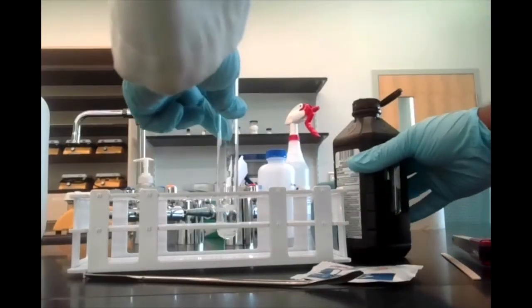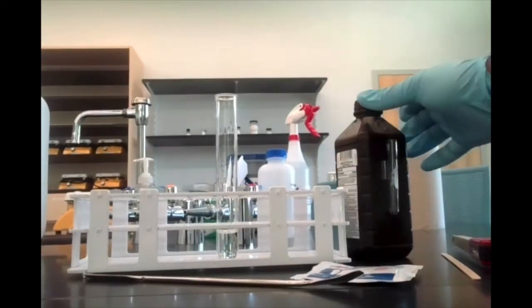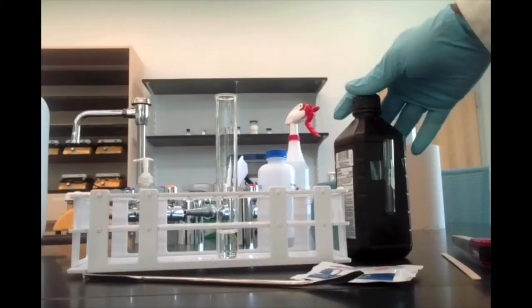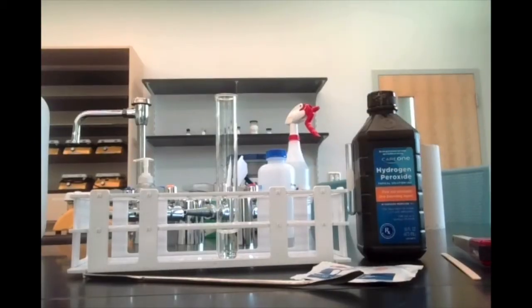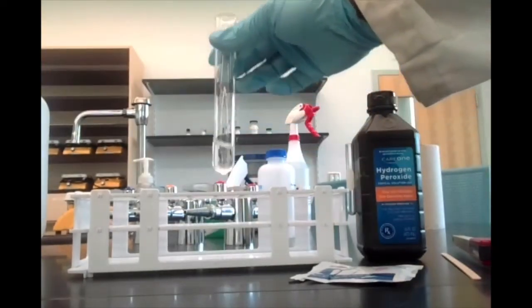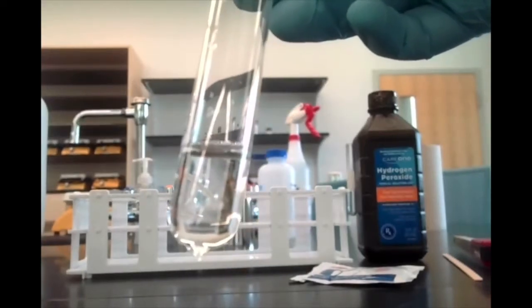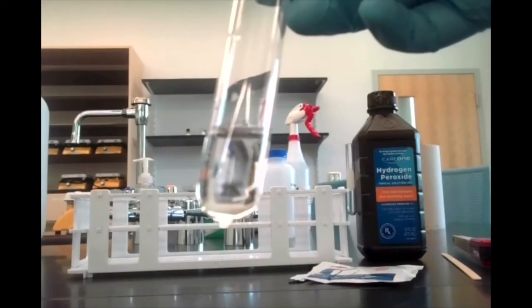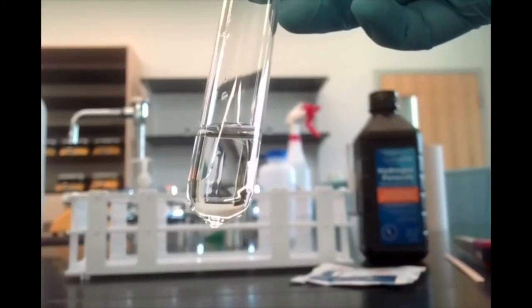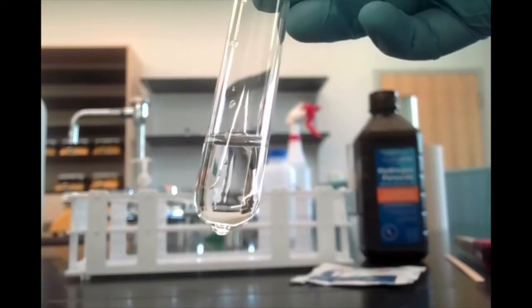Add a little squirt in there. Again, the directions say to add 5 milliliters. I don't think you've got to be super accurate with this, since this is a more qualitative test than quantitative. So we're just going to look for the observations here. Now, hydrogen peroxide, as you can see, is a clear, colorless liquid. Even though it's naturally undergoing the reaction we're about to observe, it's happening so slowly that it just looks like plain, clear, colorless liquid. You don't see any of the products of this reaction.